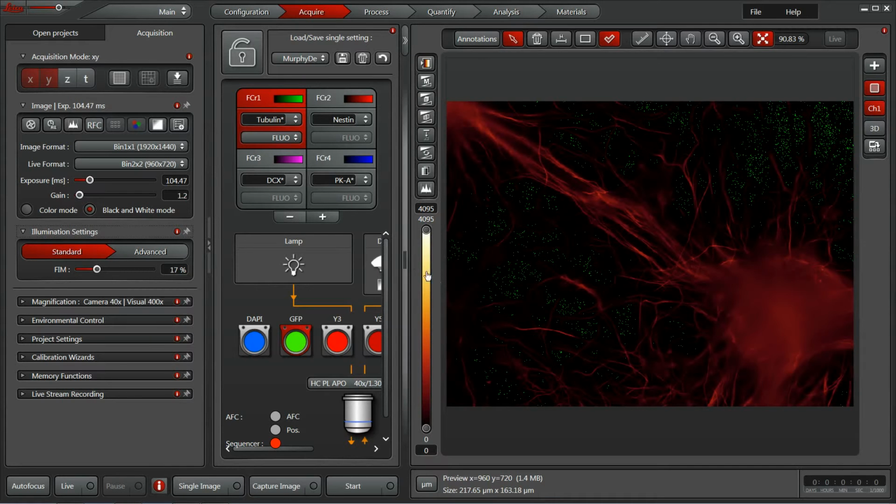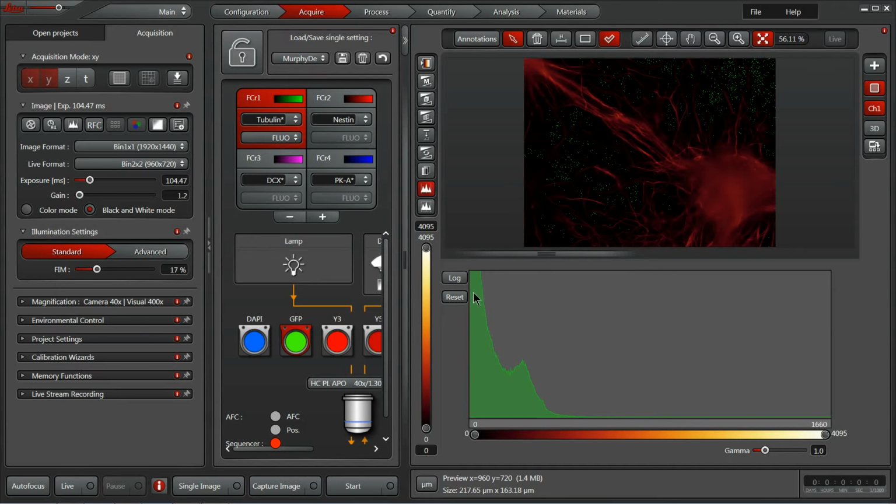The range of a system's detector can easily be displayed with this histogram button located in the image display window. I'm going to go ahead and activate that. And this will give us a graphic demonstration of the number of pixels in the y-axis at each gray level displayed here across the x-axis of the detector. Now this is helpful because a pixel on a camera that creates the pixel on the image is ultimately limited by the range displayed here. If we collect more photons converted to electrons within that pixel, then ultimately it will overflow. And as the electrons overflow that capacity, we lose both information and the attractiveness of an image. So we want to operate within that range and avoid any saturation.